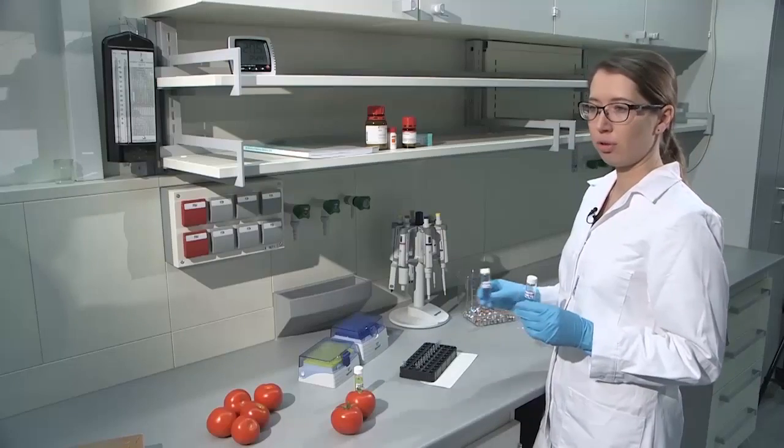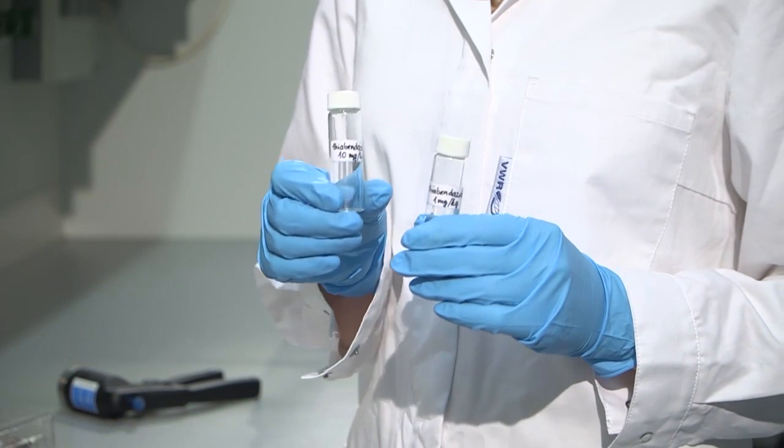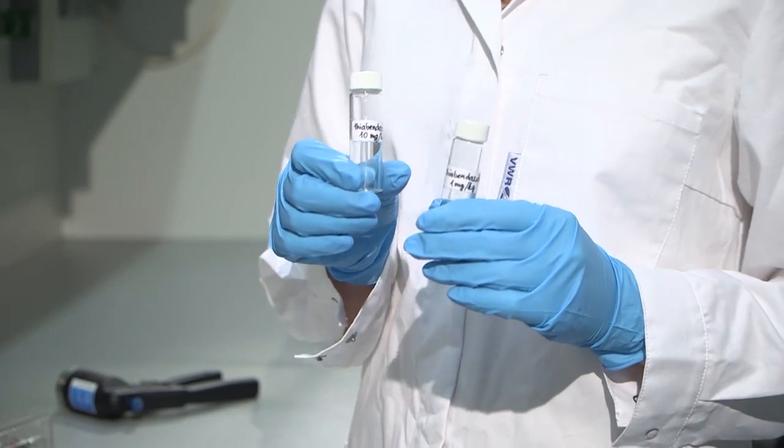Therefore, we will be preparing 10 matrix match calibration samples with concentrations from 1 microgram per kilogram to 1 milligram per kilogram, so that the concentrations are approximately evenly spaced. In order to achieve that, I will be using two stock solutions with 1 and 10 milligram per kilogram concentrations. Now, let's start.